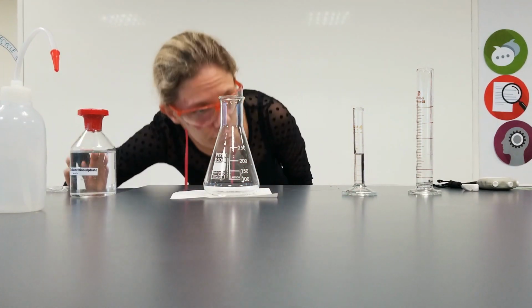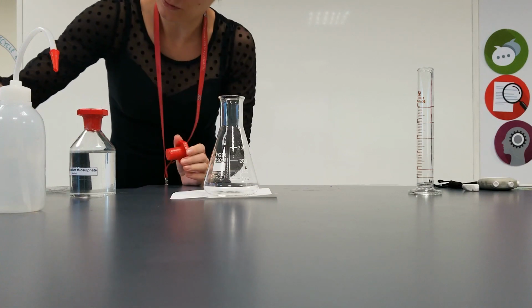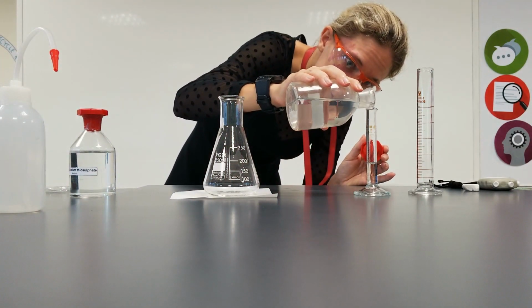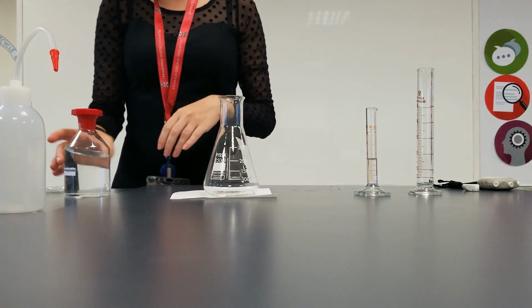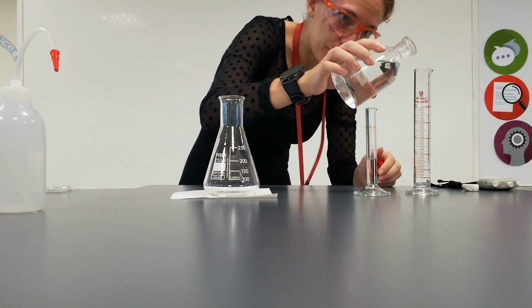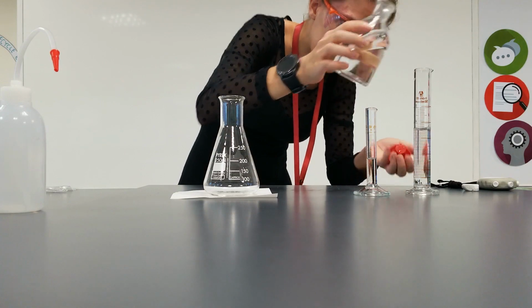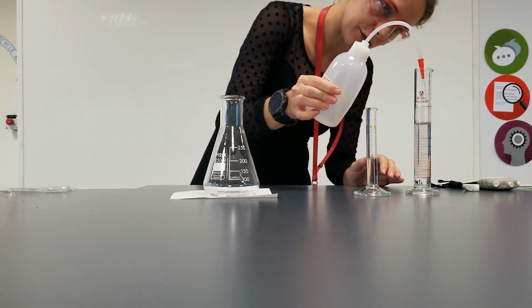So let's check that's 5. That's too much. There we go. So let's pour out a little bit. A bit better. Tiny little bit more. There we go. And this time, as our table says, we're going to need 35 of our thiosulfate and then top it up with 15 of water. So let's measure out our 35. There's 35 in that, and then we top it up with our distilled water to 50, so that we have diluted.